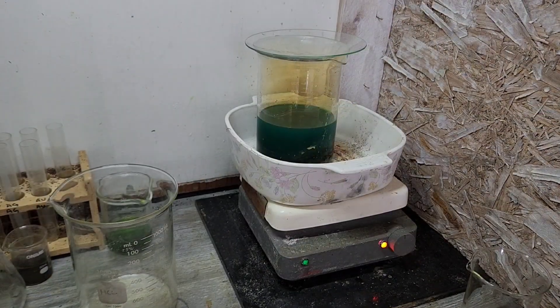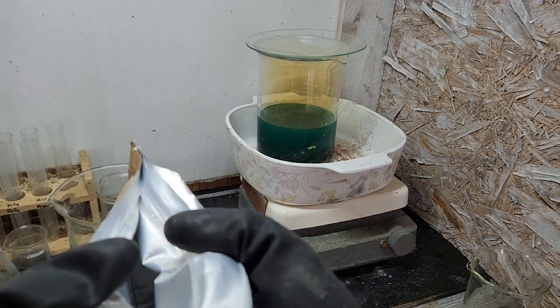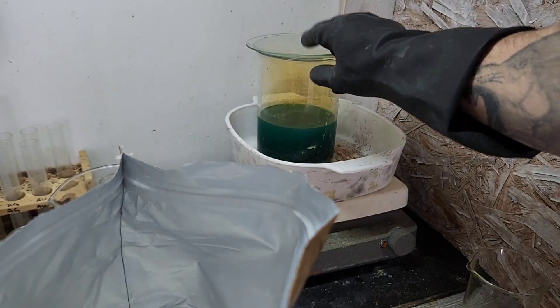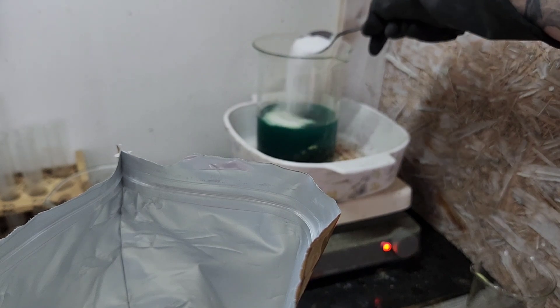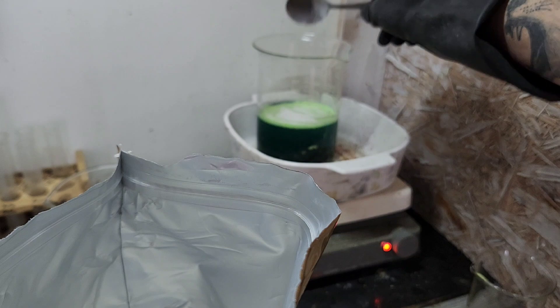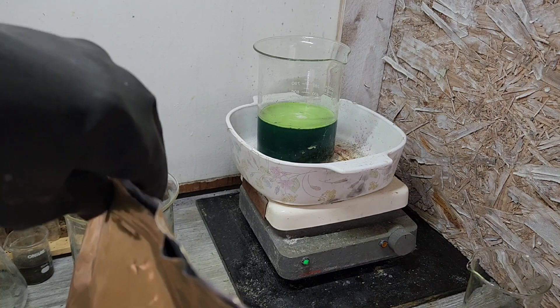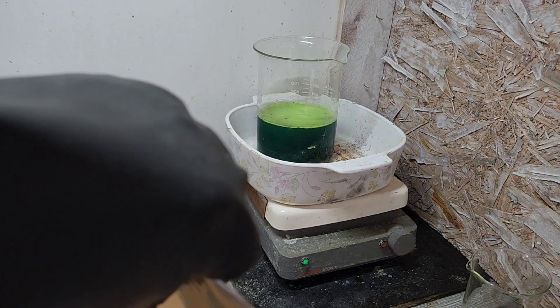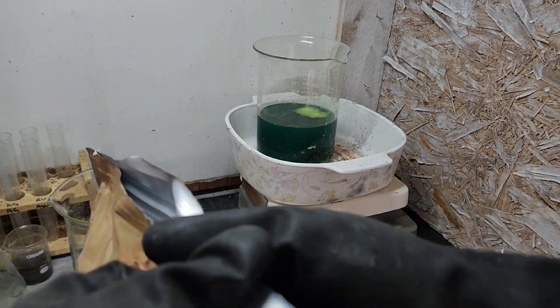Our solution has died down just a little bit. I think what I'm going to do first, before we start putting sulfuric in, is just try and add a tablespoon of our potassium nitrate. Let's see if that's good. Definitely not the same exact reaction we had off the bat, but it still looks like it's working. Let's do one more of those.